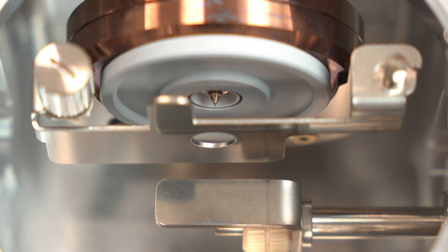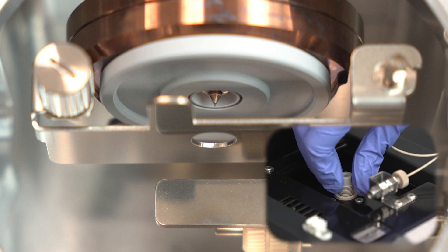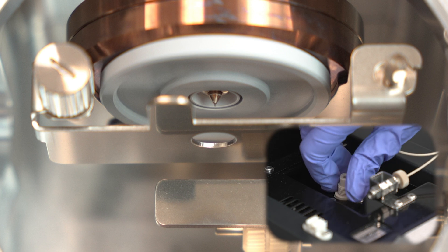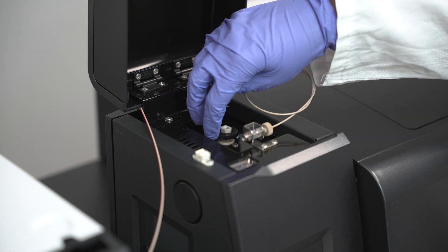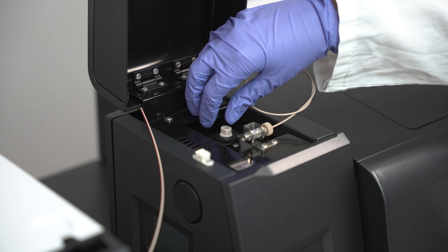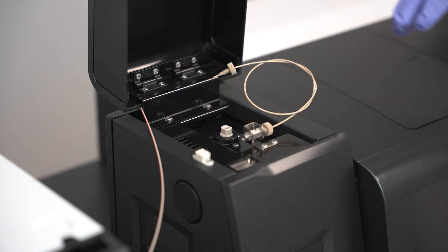It is a general recommendation to have a probe protrusion between 0.5 and 1mm. To adjust the ESI capillary, first make the needle flush with the tip, and turn the assembly clockwise. Each 180-degree turn extends the needle by 0.5mm. Once you set the capillary protrusion as desired, you can secure the assembly in place with the locking knob.